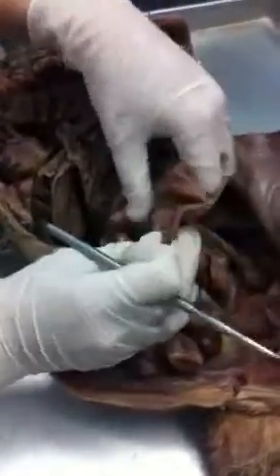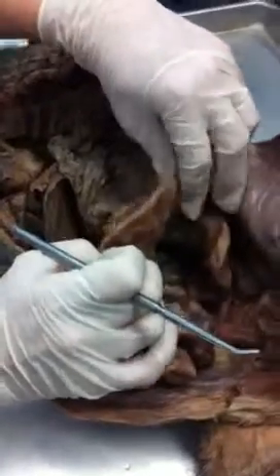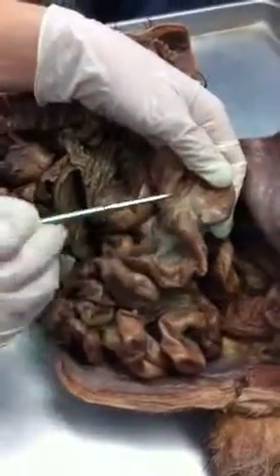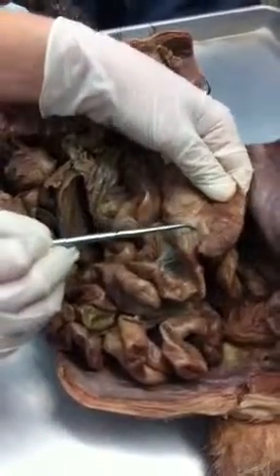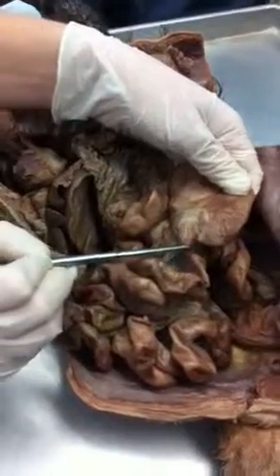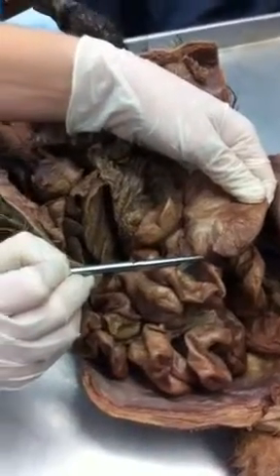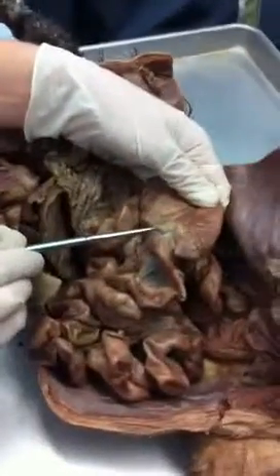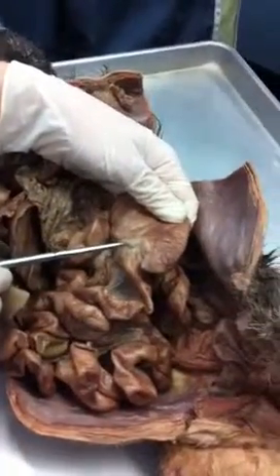Okay? So I would have it pinned very close to the, what is this right here? Large intestines. Another word for it? Colon. Excellent. So here's the ileum of the small intestines. I go through what valve? You can't see it, but it's in this area here. What's this called again? Ileum. What is this right here? The cecum. So we go through the ileocecal valve.